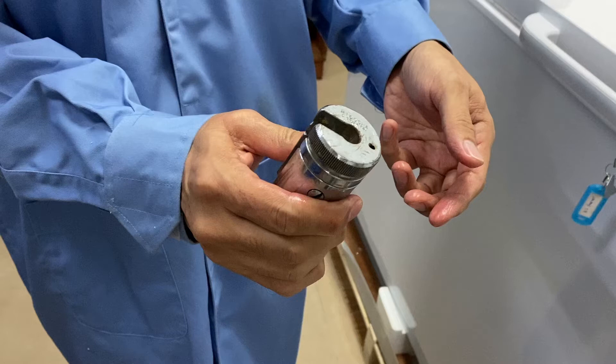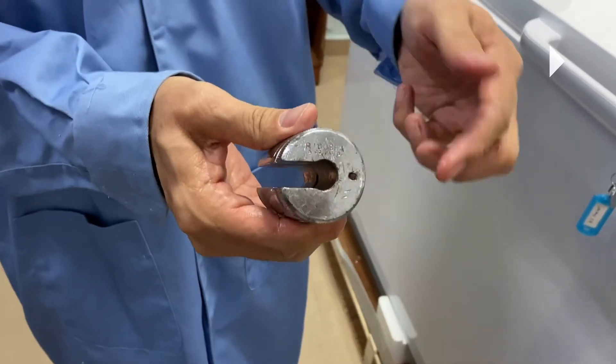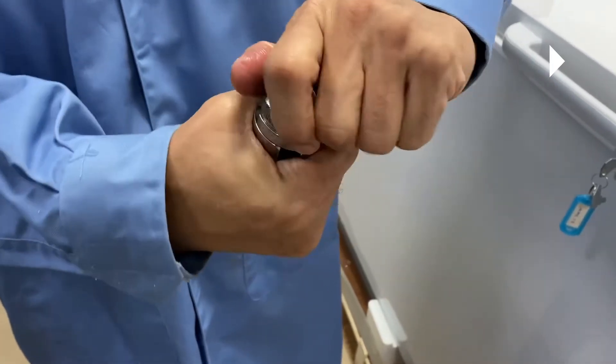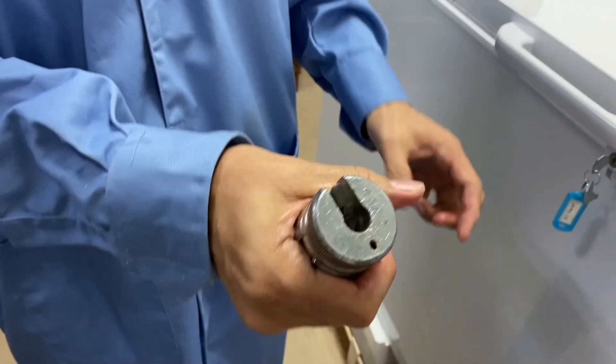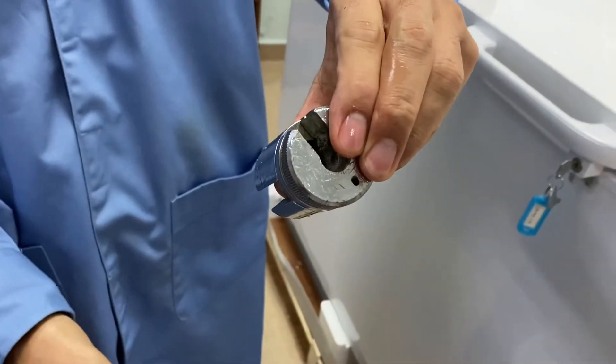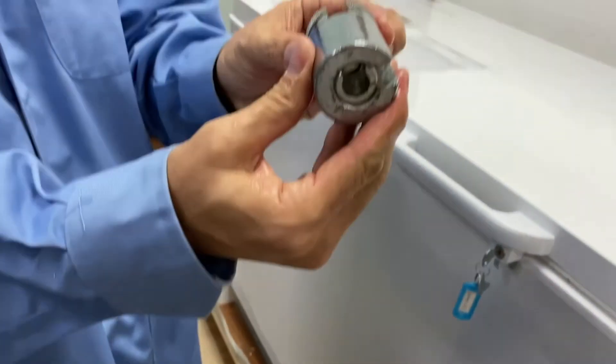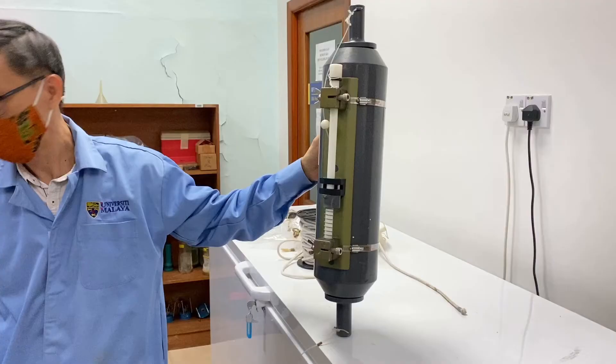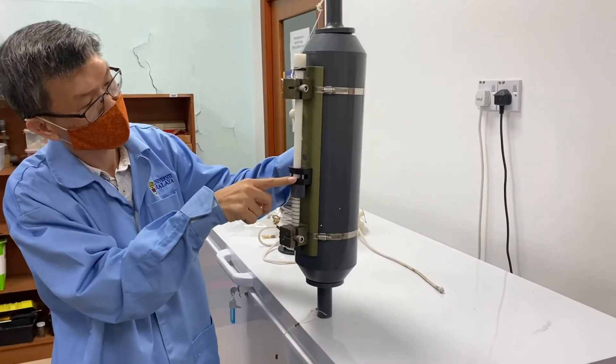This is another design of a messenger — a much better design where you can easily place the cable inside and lock it by just turning the top. From here the cable is locked and the messenger will not drop off.